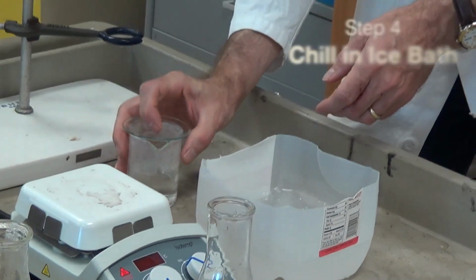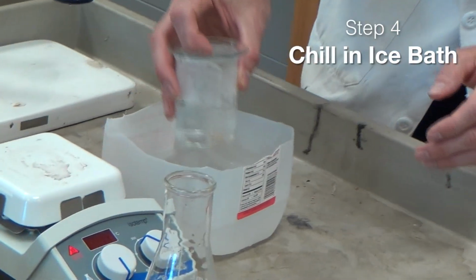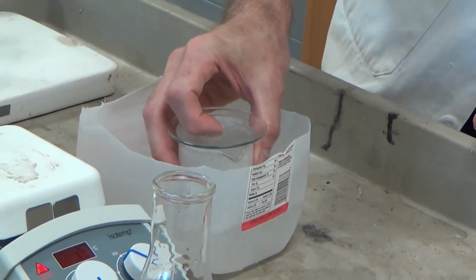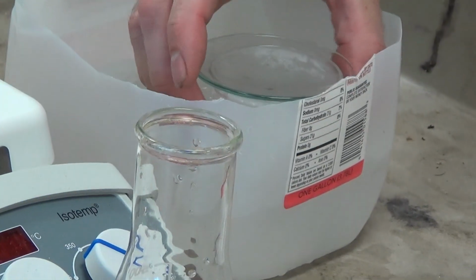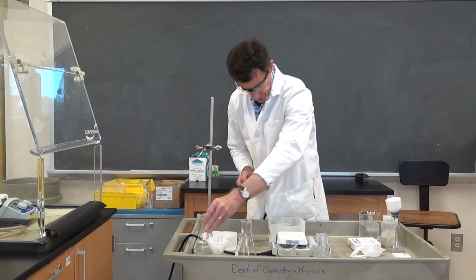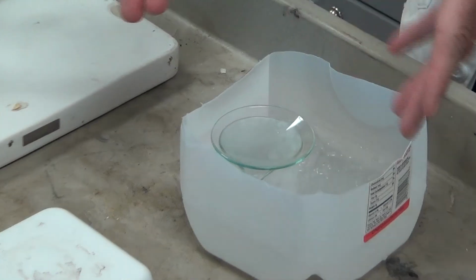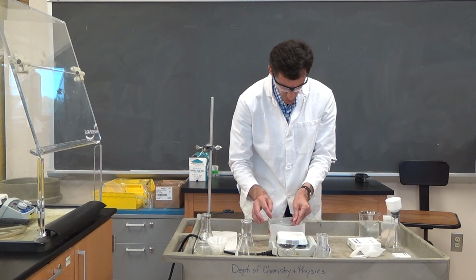So this is cool enough to ease into our ice water bath. Sort of kind of ease it in. It's still a little warm. I think that's sufficient. We can get it down in there. Looks like it's sitting nicely. You certainly don't want this to turn over in your ice bath. You'll be fishing for crystals. There, got to keep an eye on that.